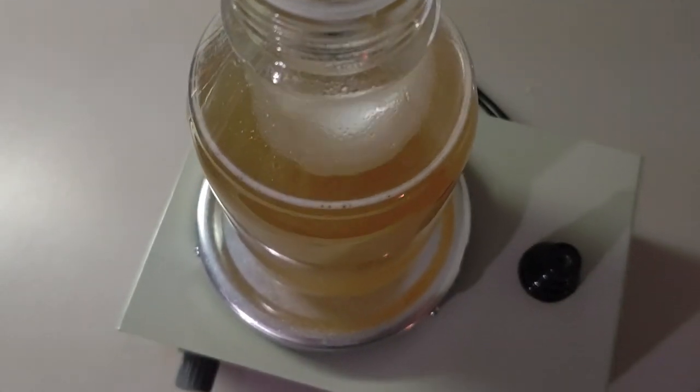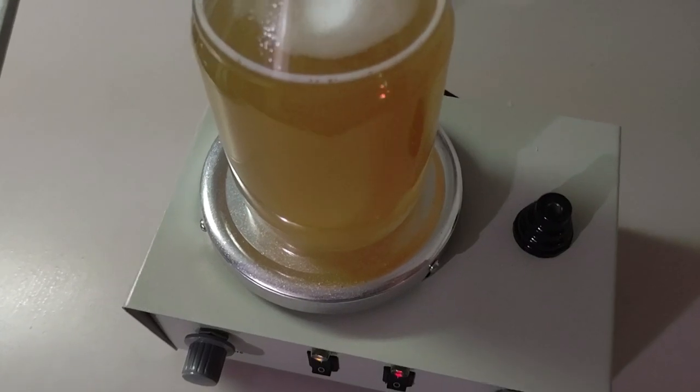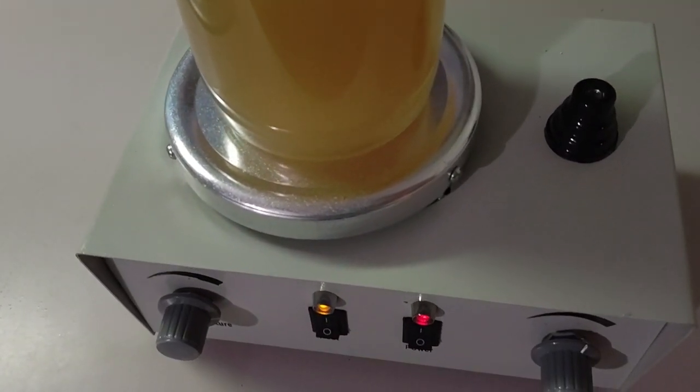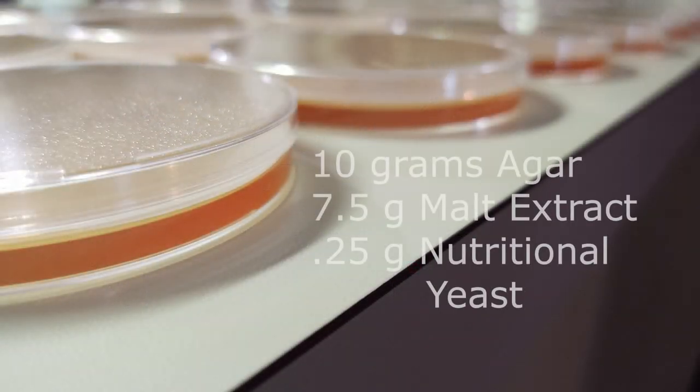When working with the nutritional yeast, even when you've created a fine powder, it will leave a cloudiness to your agar and particulates. We've tried straining this out, and it's still there, and it's okay. We have not experienced any contamination. It's been a really positive recipe with just so much rhizomorphic growth. The particulates and the cloudiness are just not a problem at all.